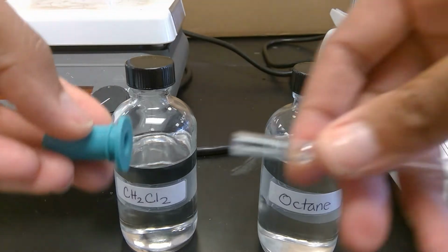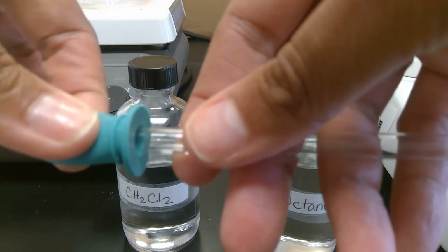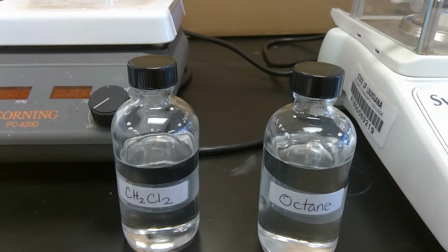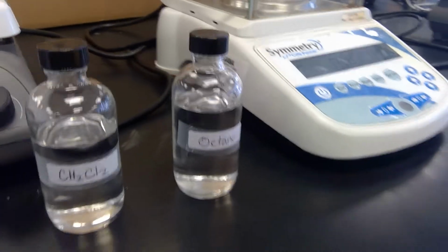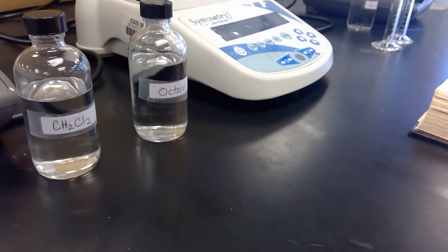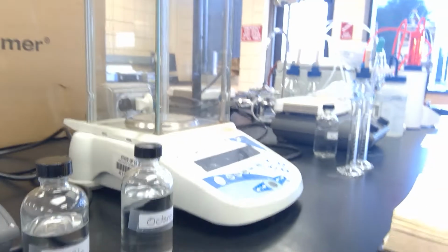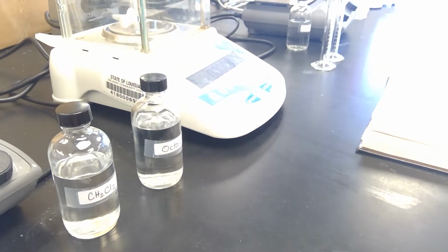So what I'm going to do is take a pipette and a pipette bulb, and I'm going to gently put the bulb on. I'm not going to jam it in so that I have a lot of space to squeeze in order to get the liquid inside of the pipette. So I'm going to bring you back slightly so that you guys can see what we are doing. I may have to put you up and bring you closer. So hold on one quick second. All right, so that should be better.